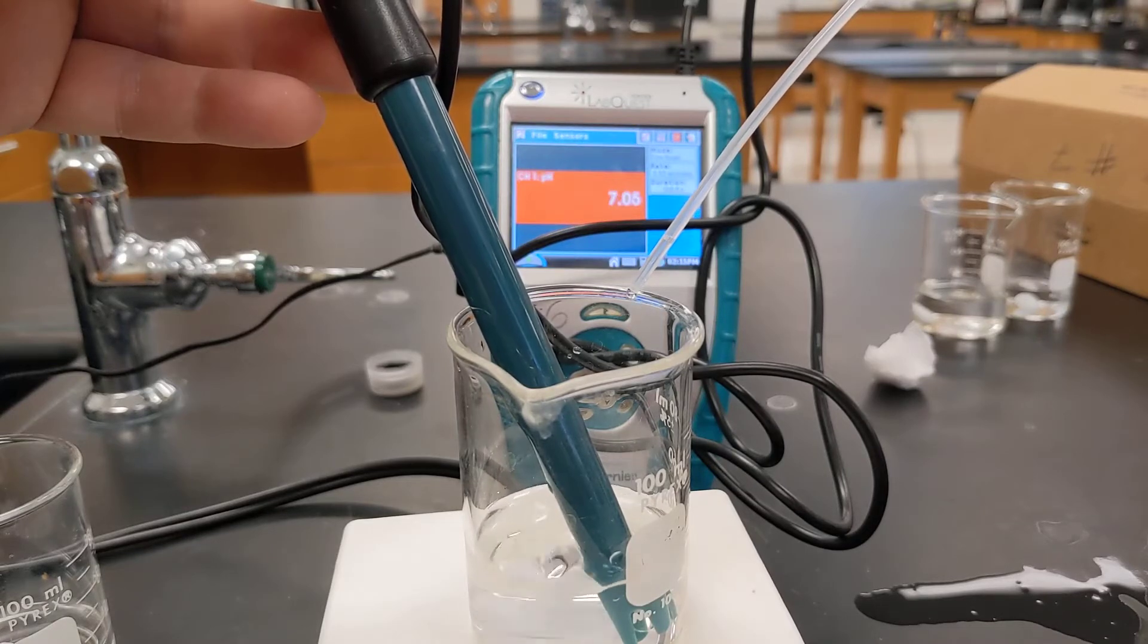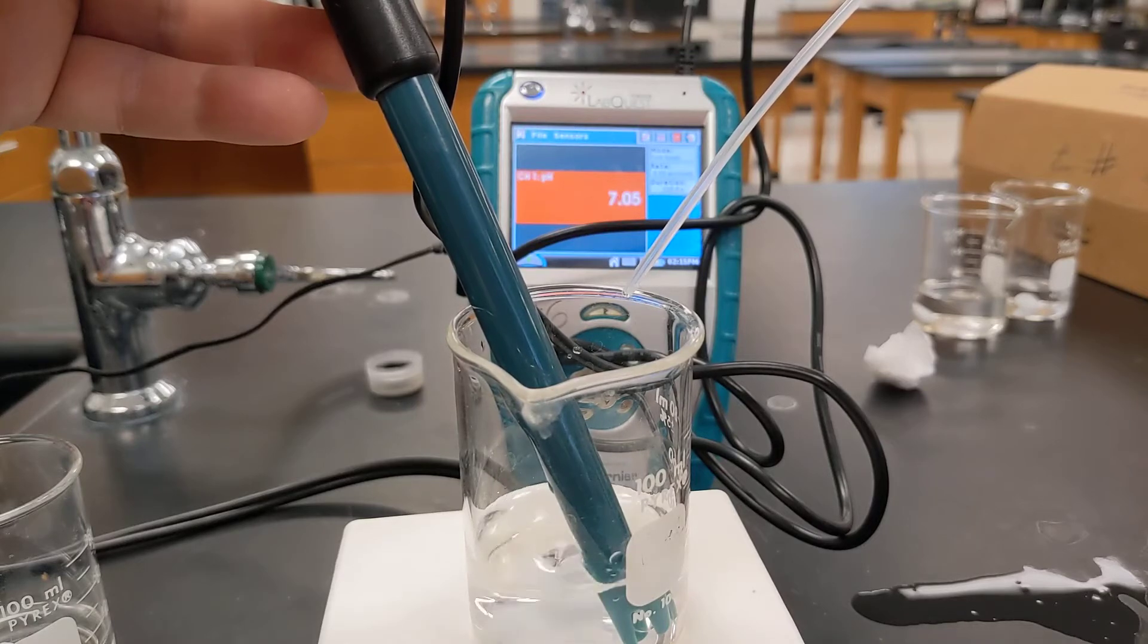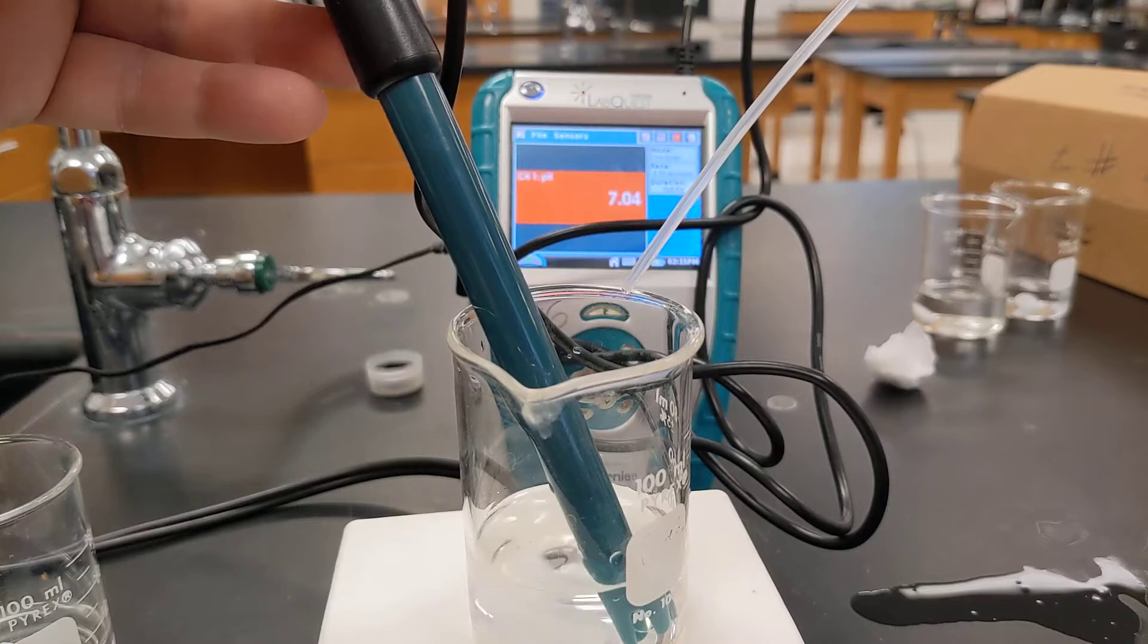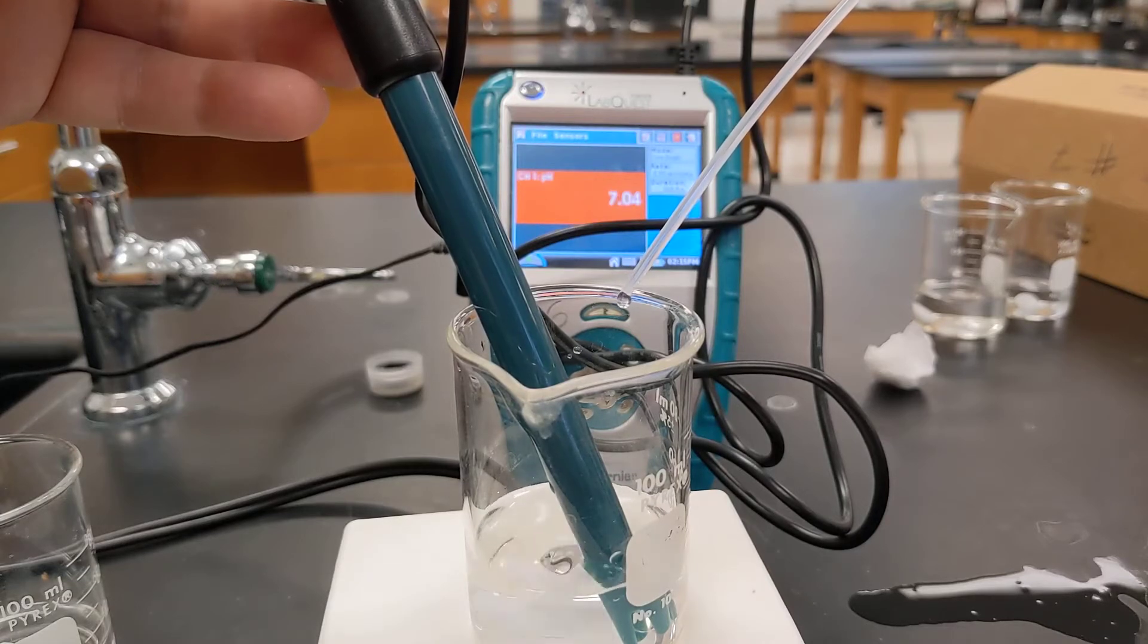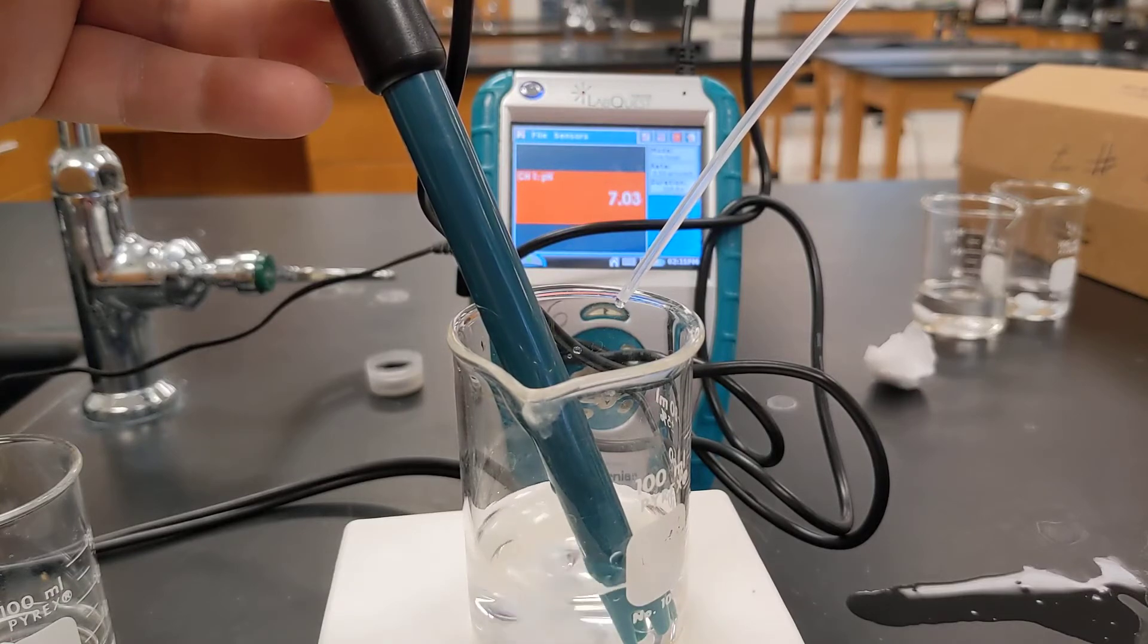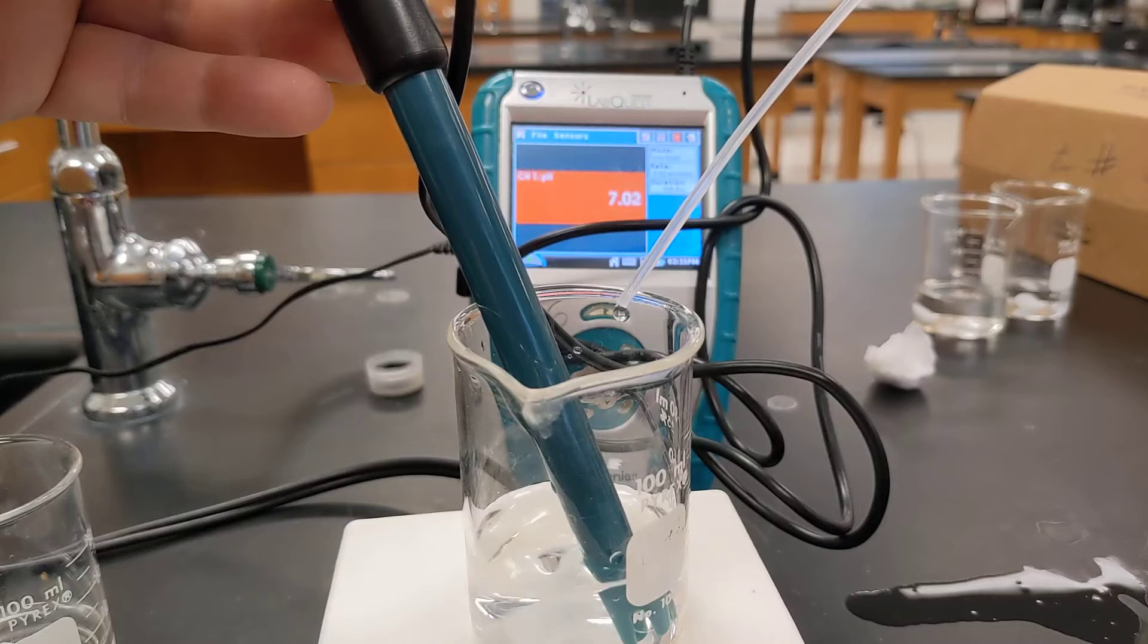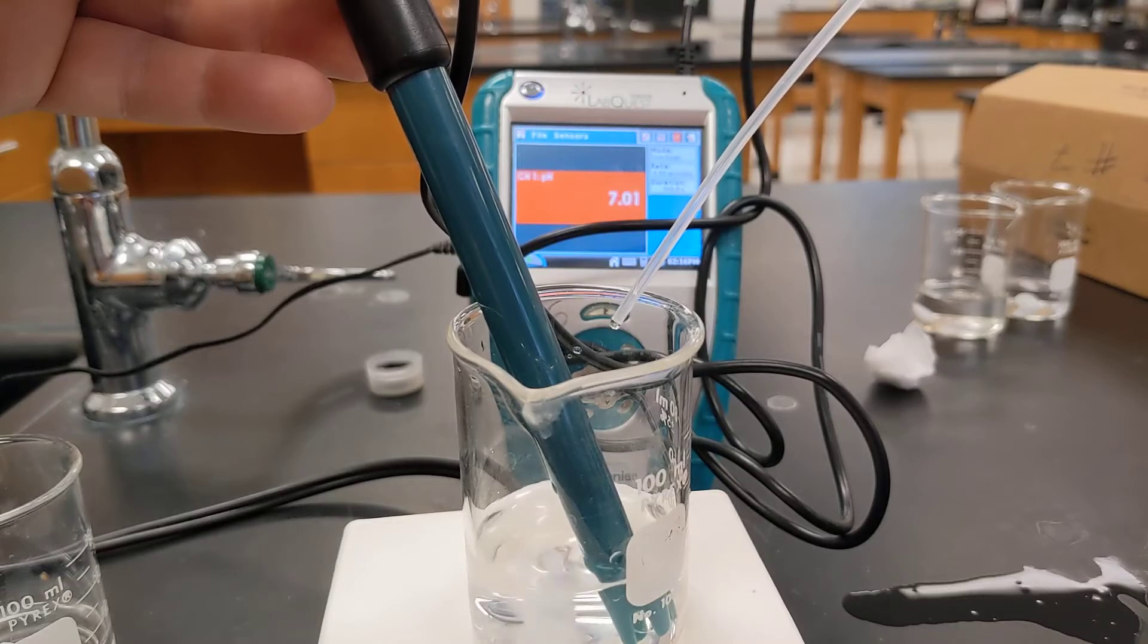I add a second drop, a third drop, a fourth drop, a fifth drop, six, seven, eight, nine, ten drops, eleven, twelve, thirteen, fourteen, fifteen, sixteen, seventeen, eighteen, nineteen, twenty.